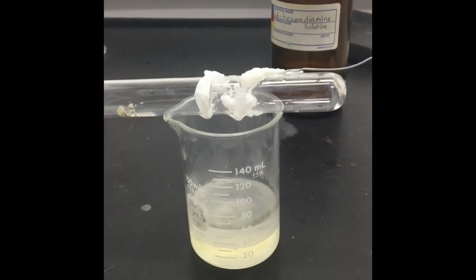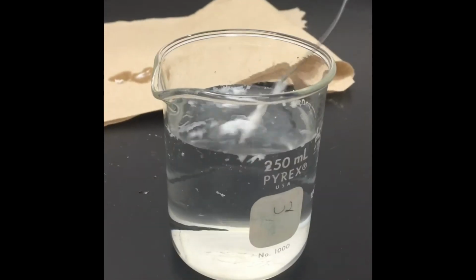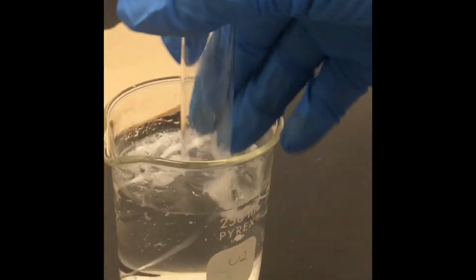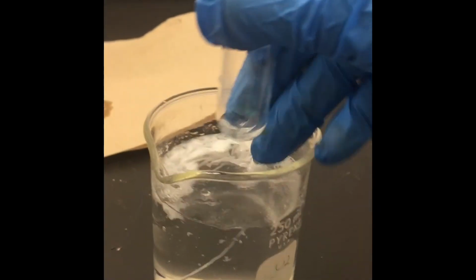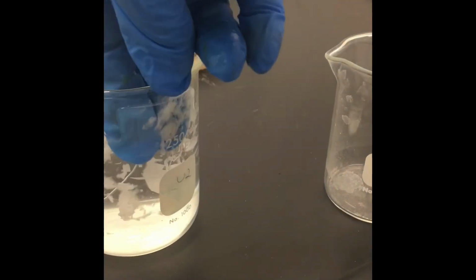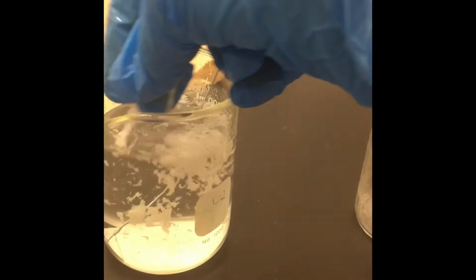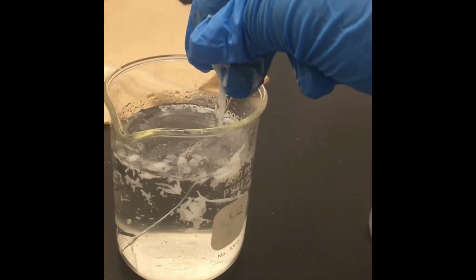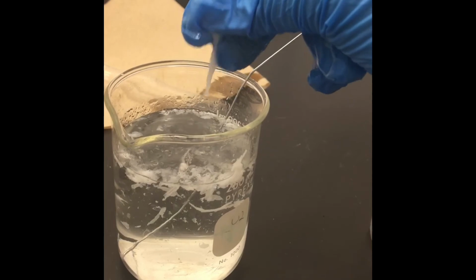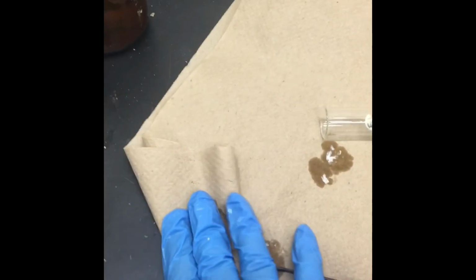And what I'm going to do now is see if I can make it safe. So I'm just going to drop it here. This is just DI water. Once I actually clean it, I can touch it. And again, it could be because maybe our compounds were not as fresh as they should be, but this is what nylon actually looks like. And it's exactly the same that is used for clothing, fishing line, stockings.